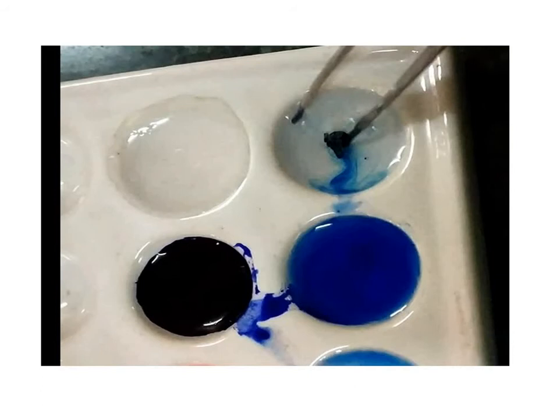After that, this ethanol is removed and again 70% ethanol is added and the section is kept in this 70% ethanol for another 1 to 2 minutes for complete removal of excess safranin from the section. Then remove the 70% ethanol by blotting and immediately add methyl green and let the section sit for 1 minute.